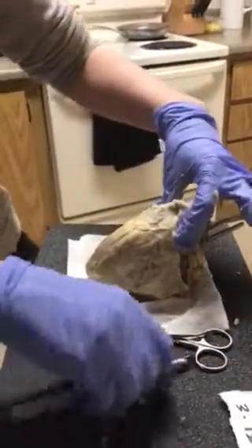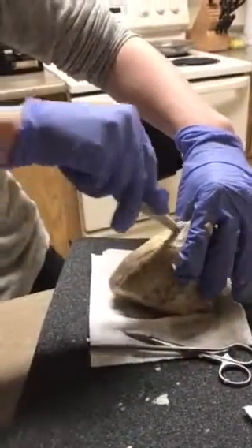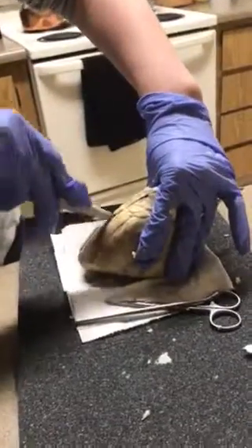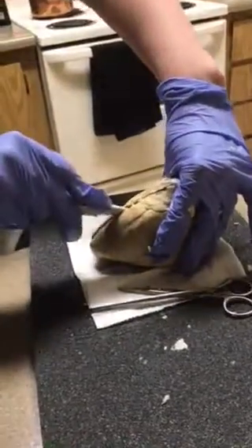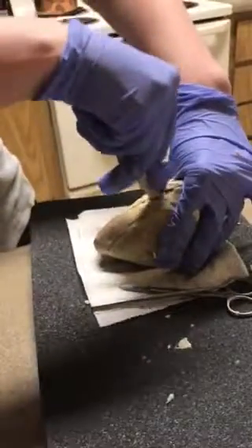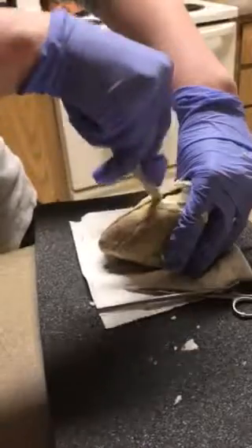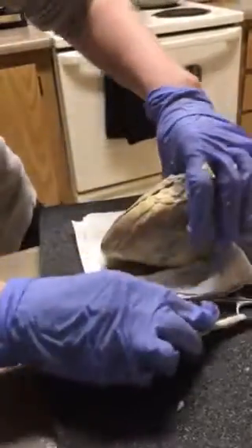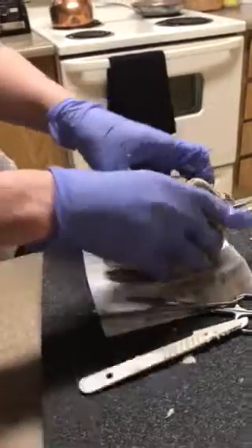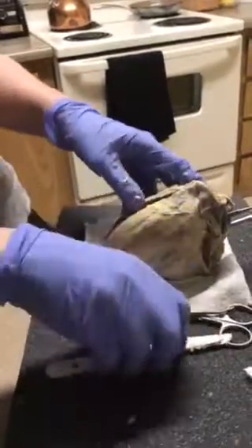I started cutting the right-hand side. Let's complete that. This is a much thinner wall. So practically open it up.